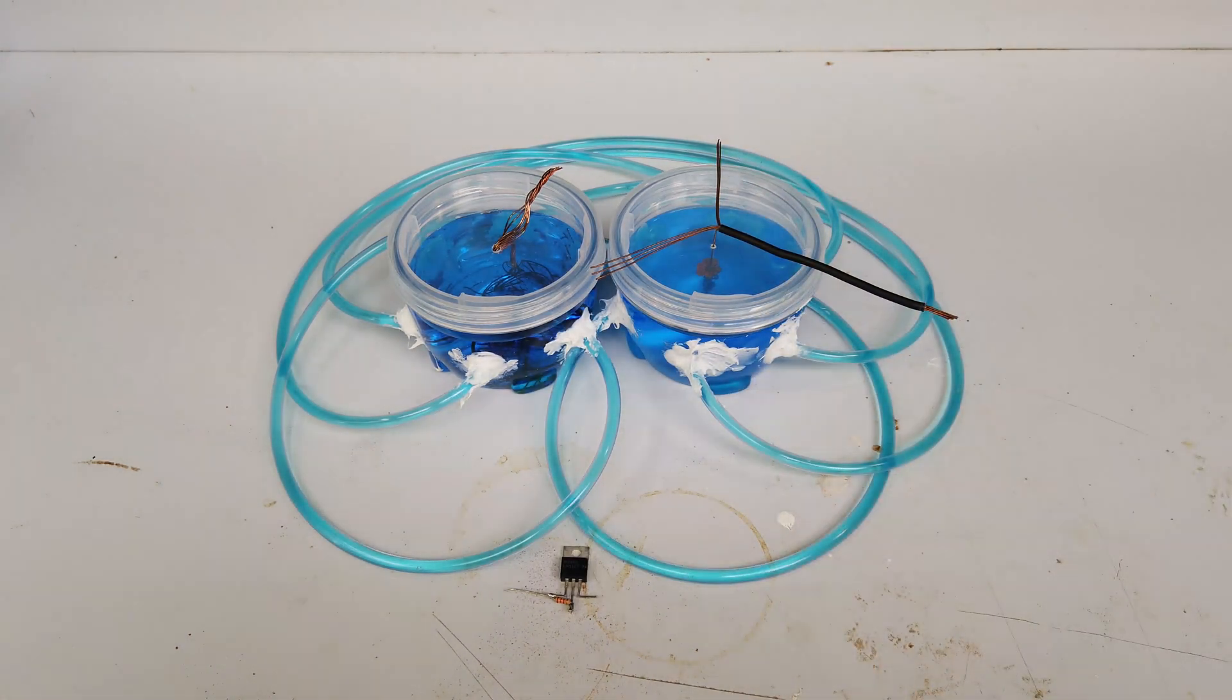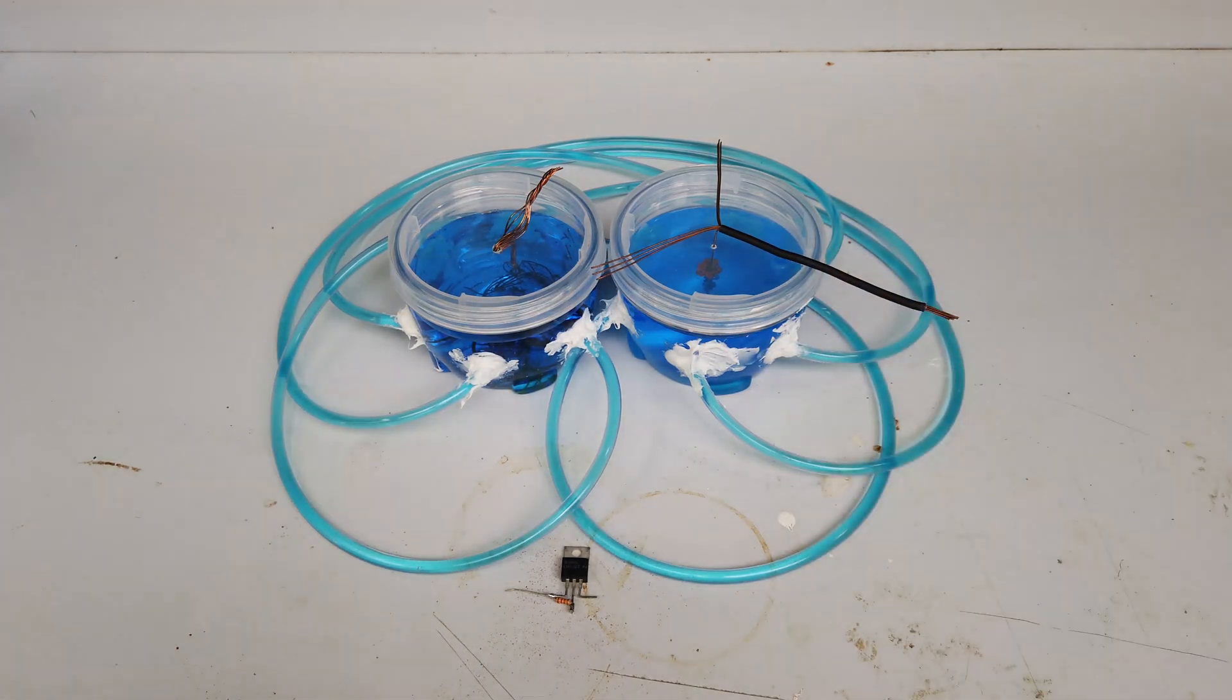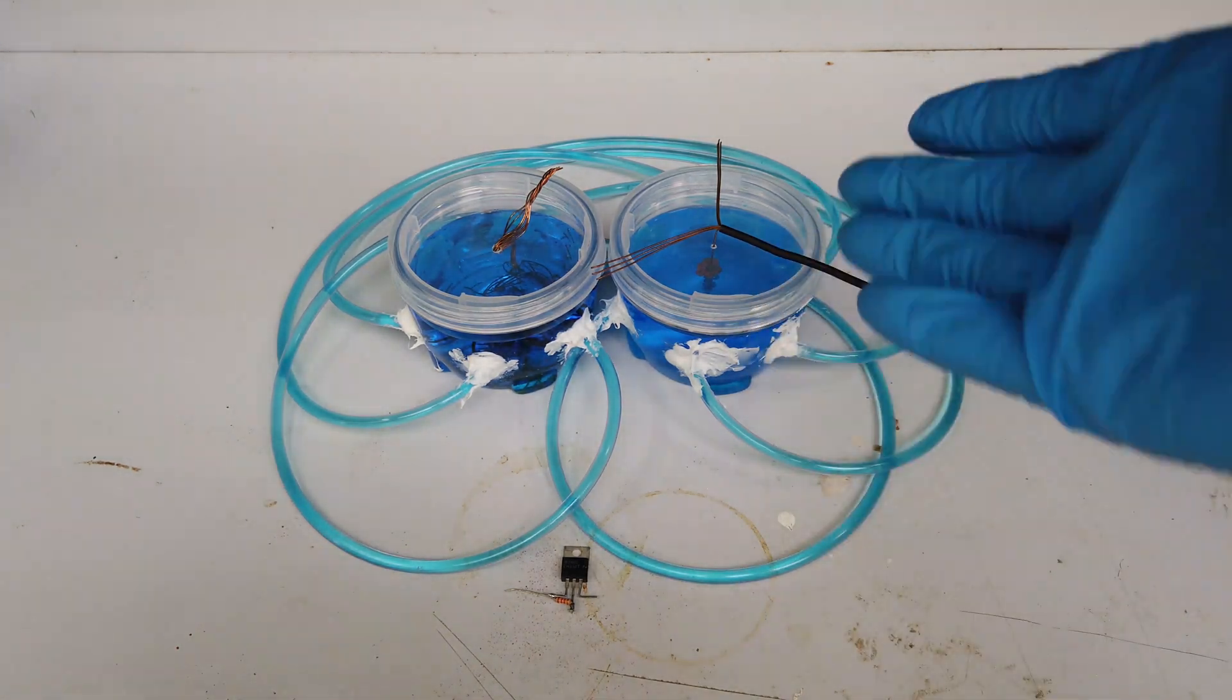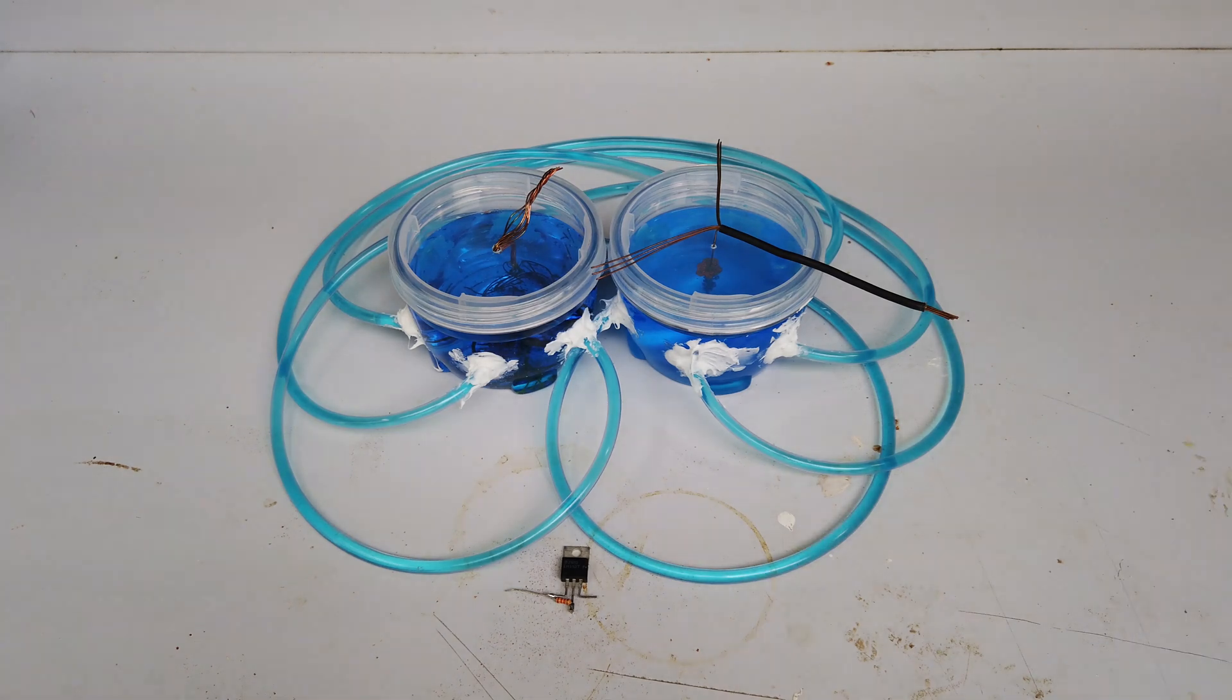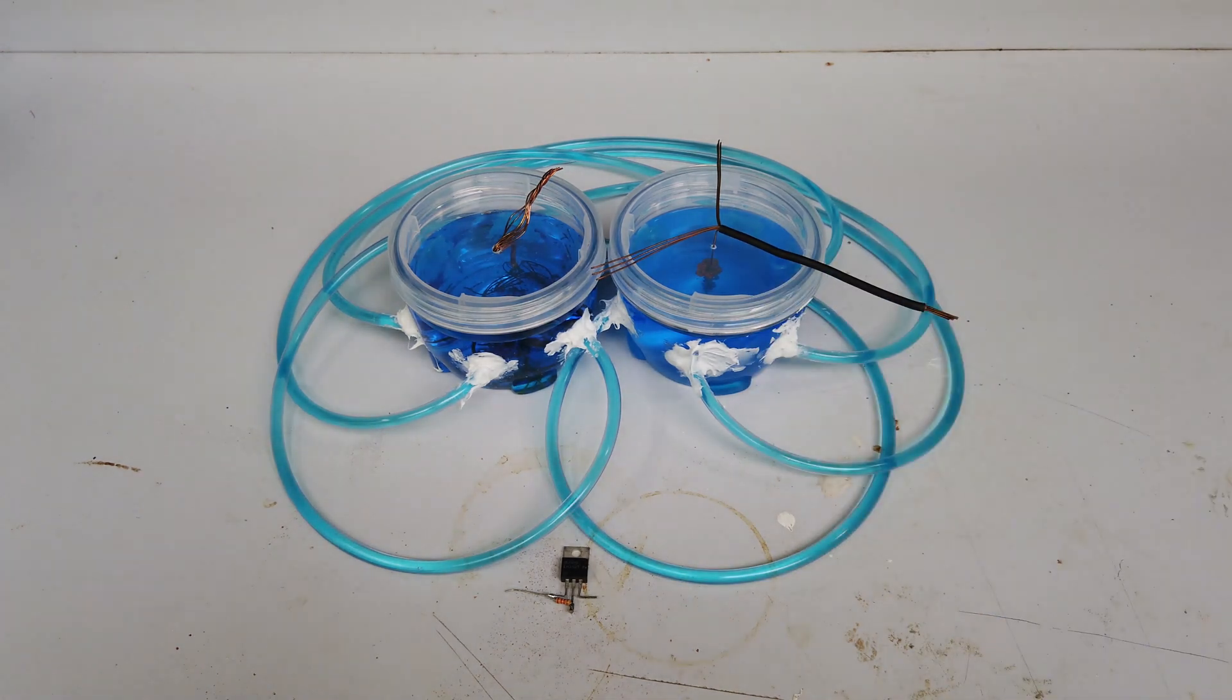We have copper crystals in there. I can see them through the container, but it will be nice to take it out and actually have a look. I haven't seen them in the last 60 days. They've just been growing in there and I haven't touched them. So I guess it's time to disassemble the cell.